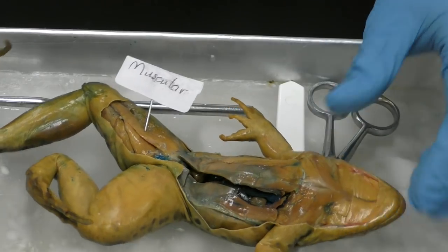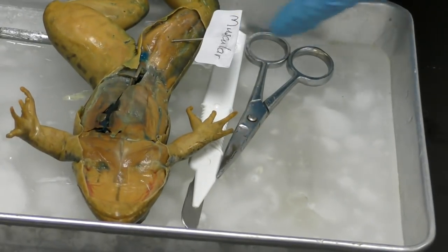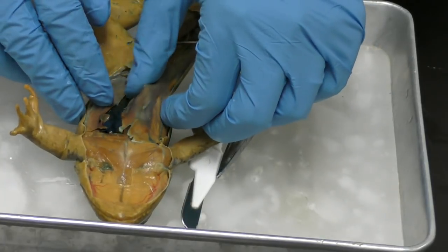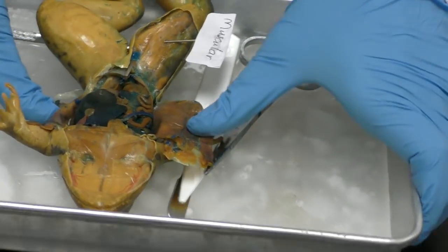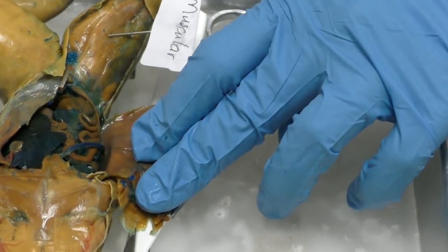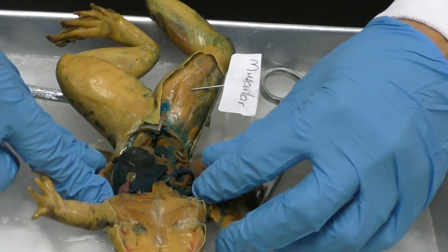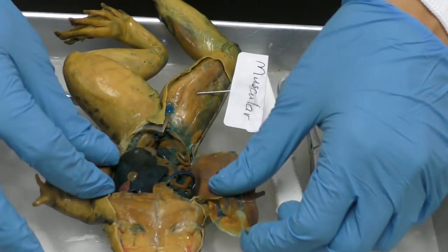All right, I'm gonna flip my buddy around. And I don't know yet whether it's a male or a female, because it's hard to say until you get inside. I have already opened up the top layer of muscles, like a barn door, and you can see there's just a lining of muscle all through the abdomen. Okay, so all of that is muscles lining the skin and allowing for this frog to be so strong in its jumping. The abdominal muscles are very strong as well.